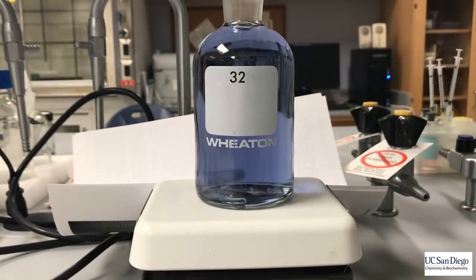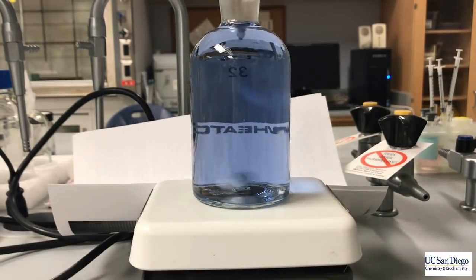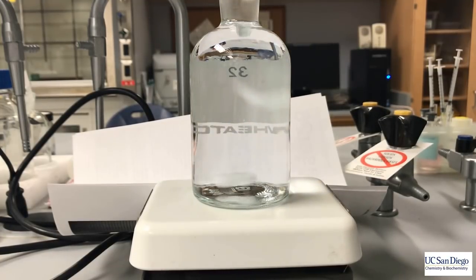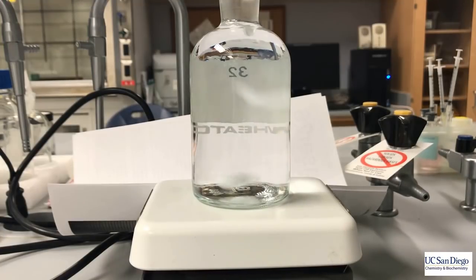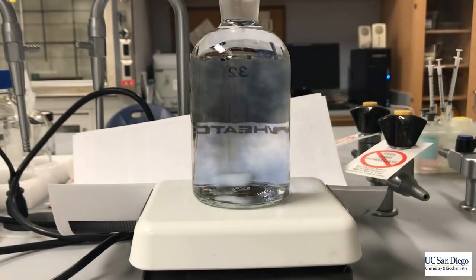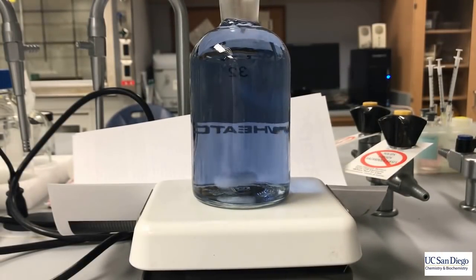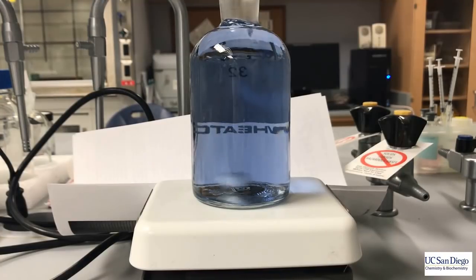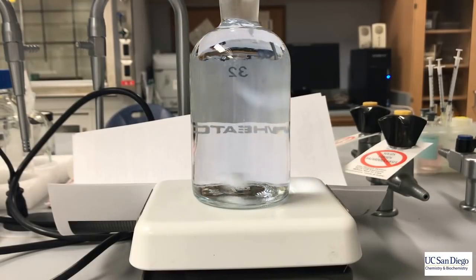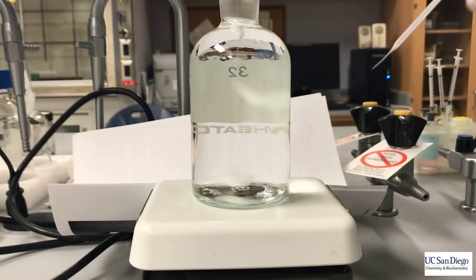Another thing to note is that because we've added one tenth the mass of our primary standard, we will be reaching our end point much quicker. Here we're adding the second addition, so this is a good time to take the weight of your pipette as your second measurement. The mass for the first titration should be slightly larger than the mass of the second titration. And now we're going to take our third measurement of that titrant pipette.